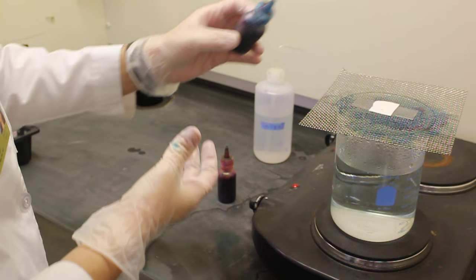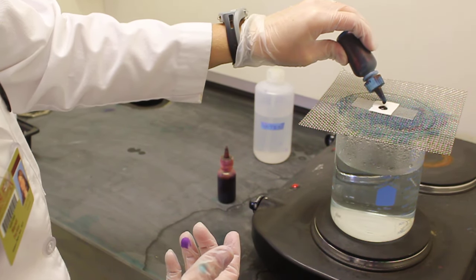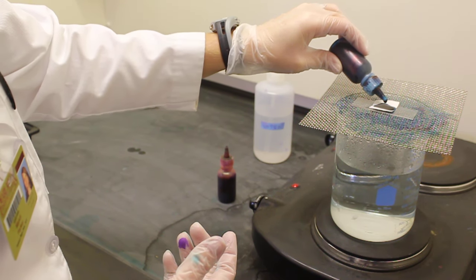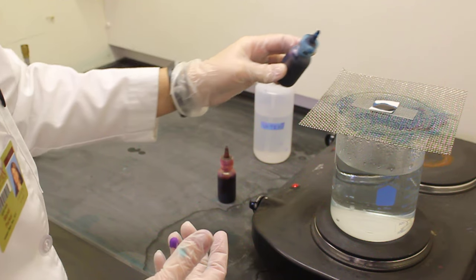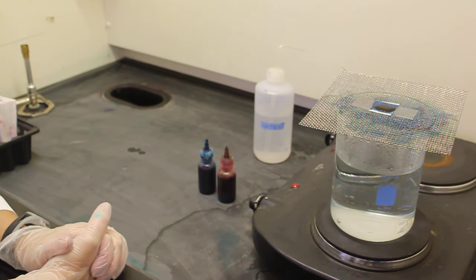The malachite green is applied to the paper and the slide while the steam is allowed to penetrate. This must be allowed to sit on the hot plate for five minutes.